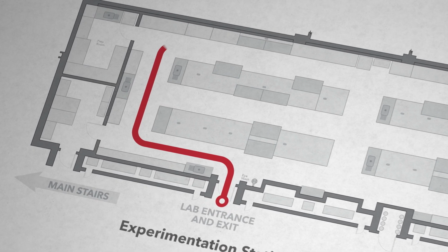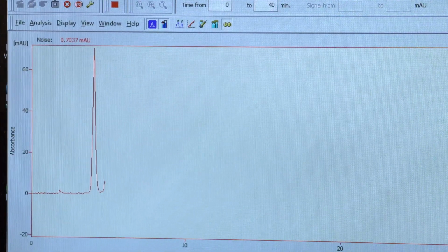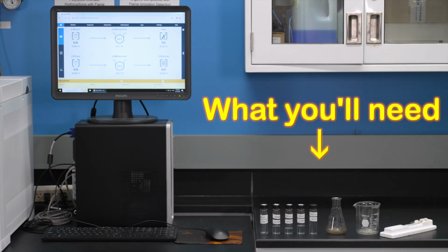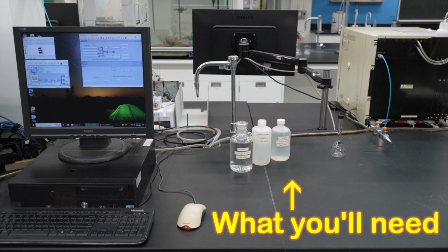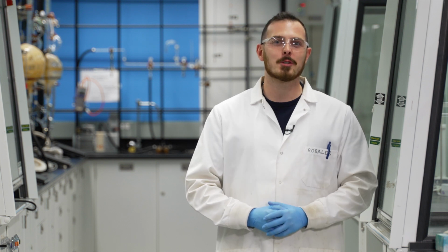Welcome back to another CHEM2303 lab experiment primer video. Gas and liquid chromatographs are used to separate and elucidate the different components that make up a sample. During experiments 4 and 5, you'll be analyzing mixtures of alkanes and small pharmaceutical molecules respectively, using pre-made methods to demonstrate how the instruments function, learning key information about separation chemistry along the way.